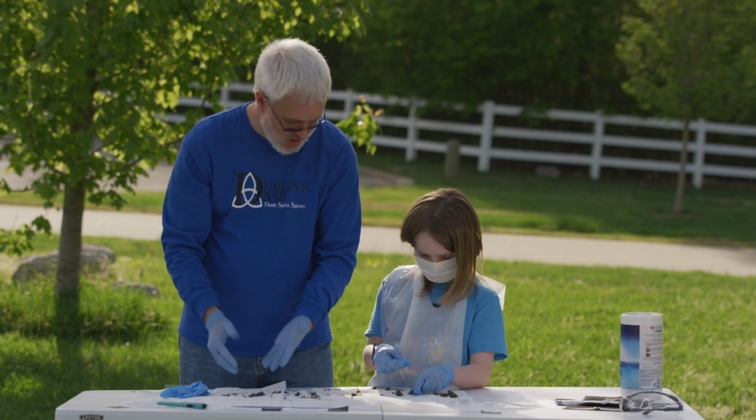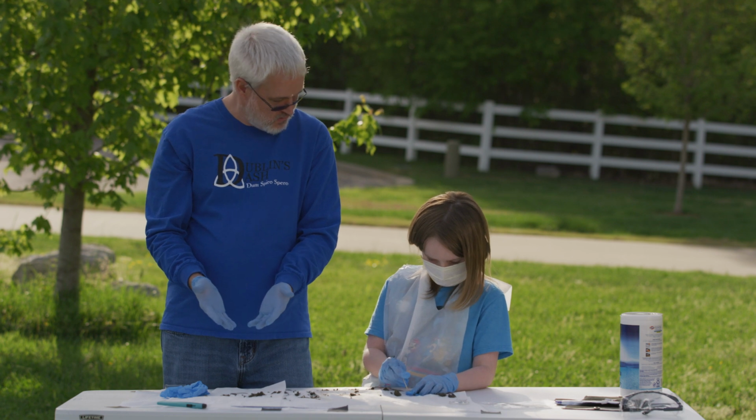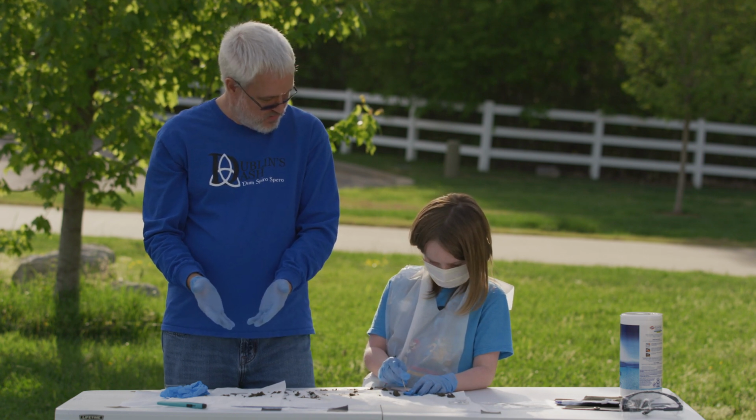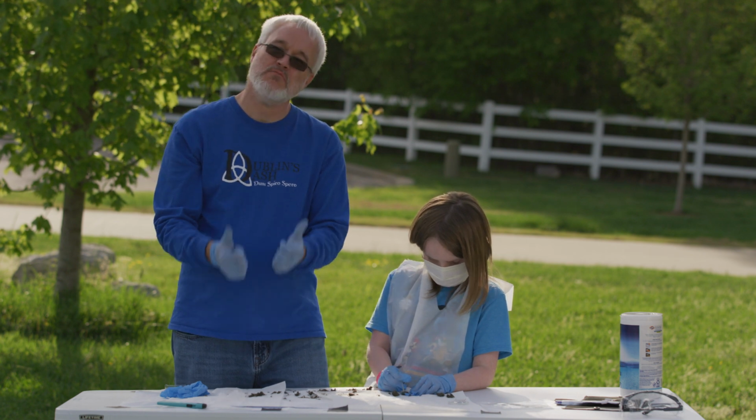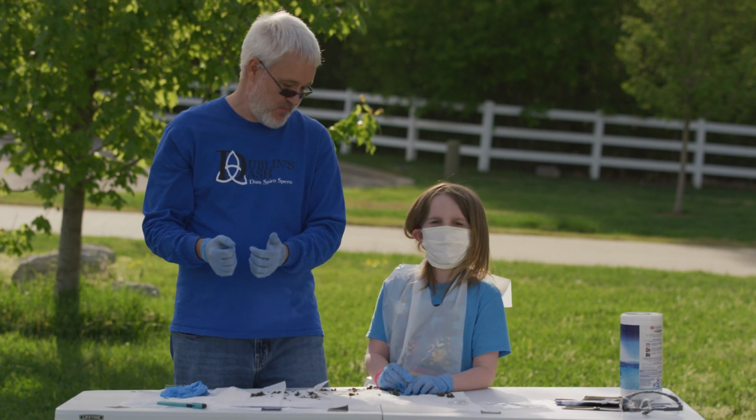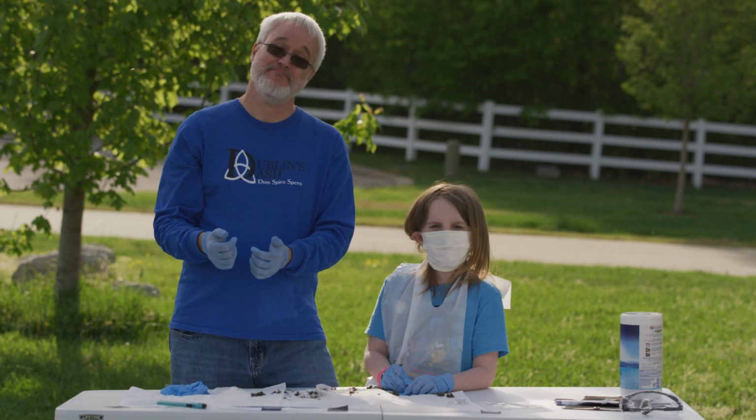And that's that. What do you think? You have anything you want to add? Hey, anything you want to tell them? All right, well, we're good. I found most of the bones. Yep, he found most of the bones. Bye-bye.